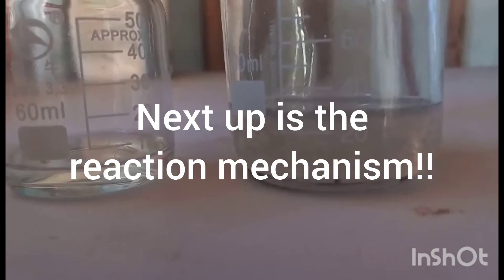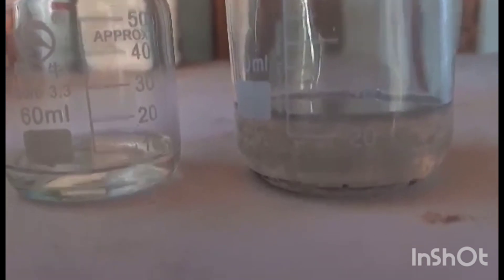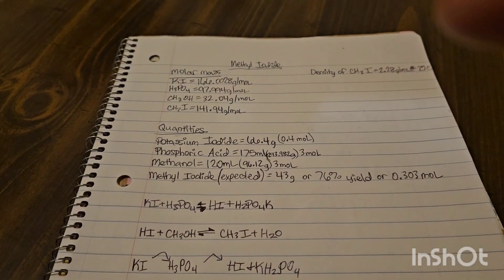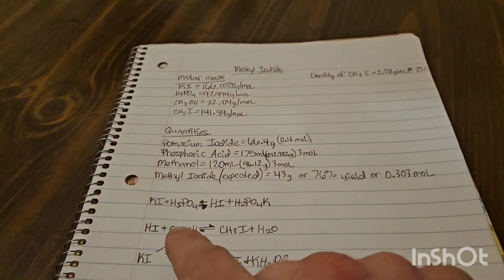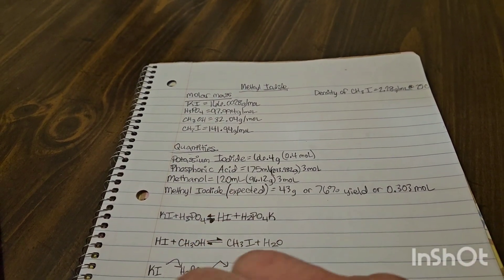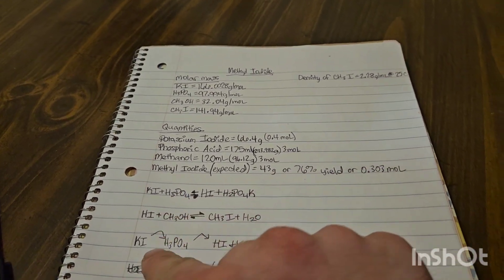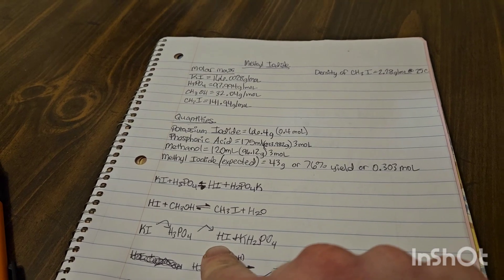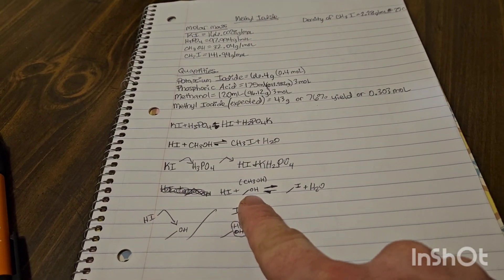This is going to conclude this part of the video — I really just wanted to try this method of making methyl iodide without using phosphorus or iodine. The reaction I did was potassium iodide and phosphoric acid in the presence of methanol. The mechanism is actually pretty simple: you're making HI in situ. The phosphoric acid attacks potassium iodide, leaving potassium dihydrogen phosphate and hydrogen iodide. The hydrogen iodide then immediately reacts with the methanol to make methyl iodide and water.